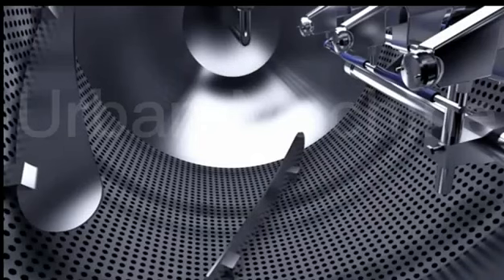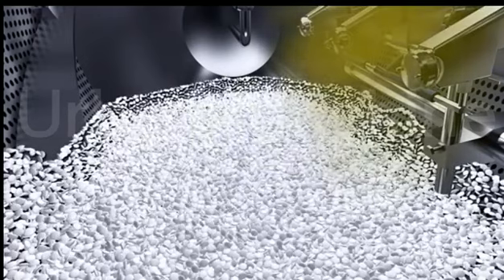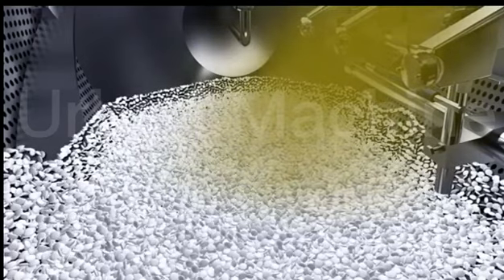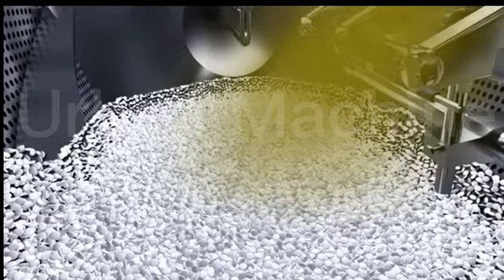Coating process: 1. Tablets into pan. 2. Preheating tablets — open hot air, exhaust air, and the atomizing machine. 3. Set temperature to 60–75 degrees Celsius. Preheating hot temperature should reach 38–42 degrees Celsius.